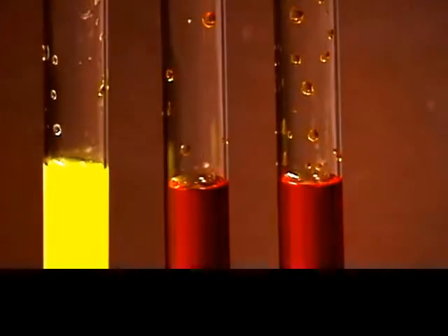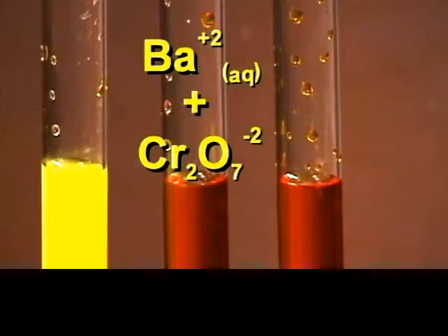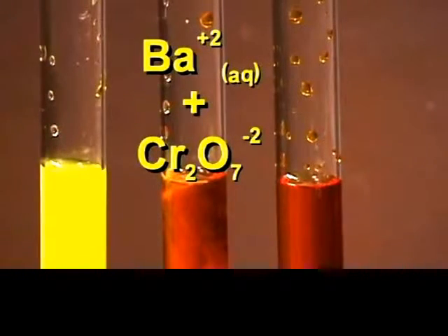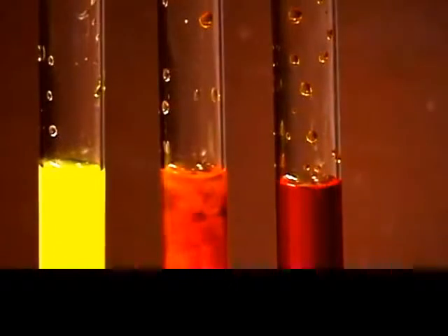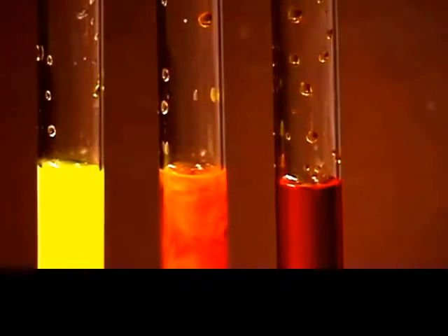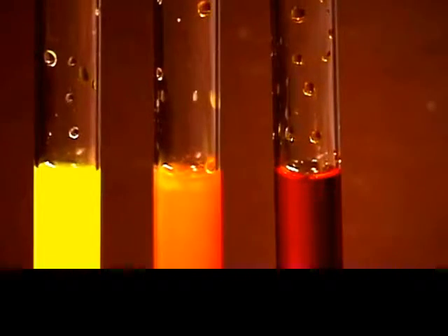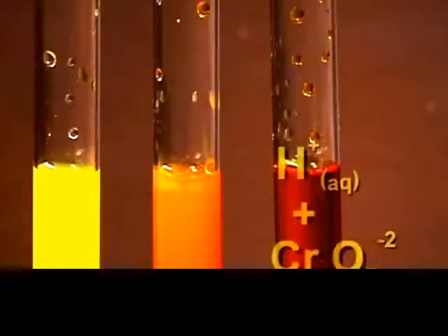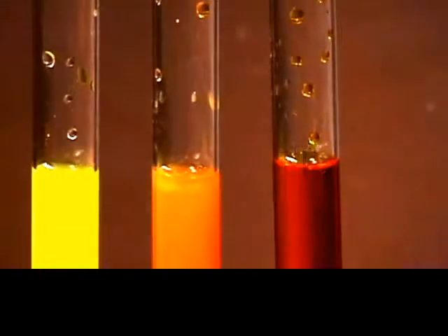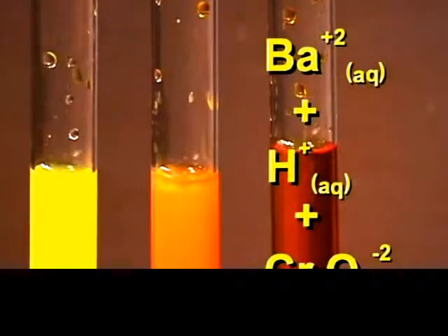We are going to add a solution of barium chloride to the second tube. To the third tube, we are going to add some nitric acid first, and then we are going to add barium chloride to the solution.